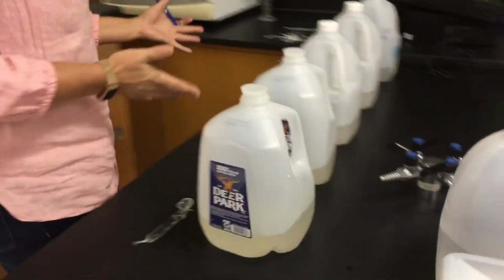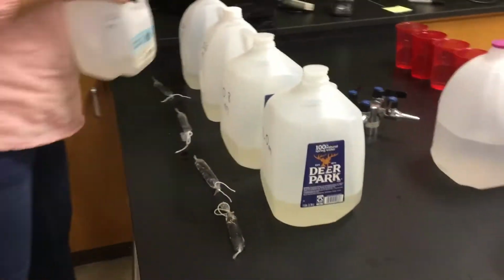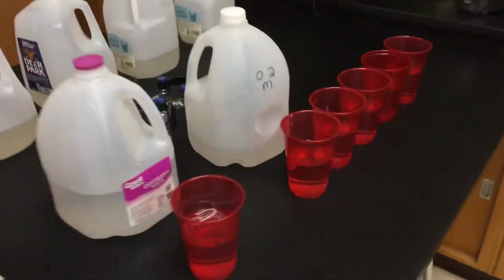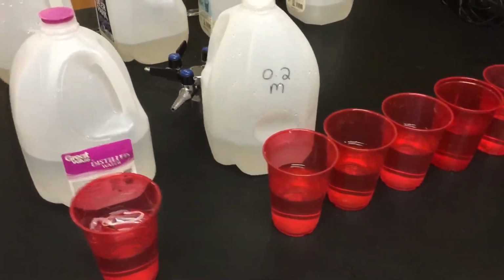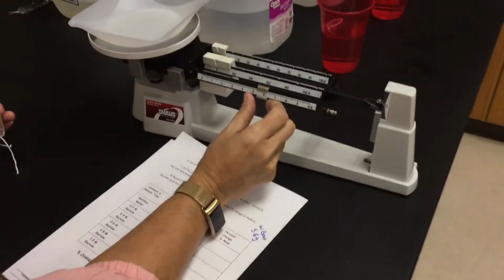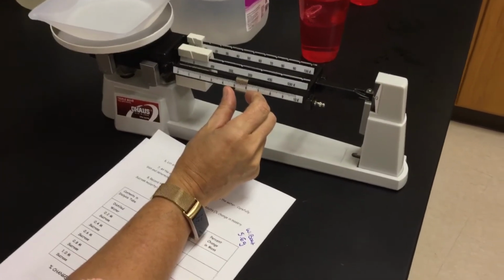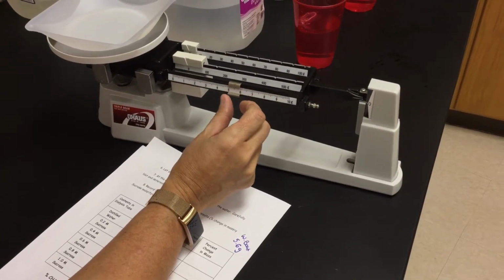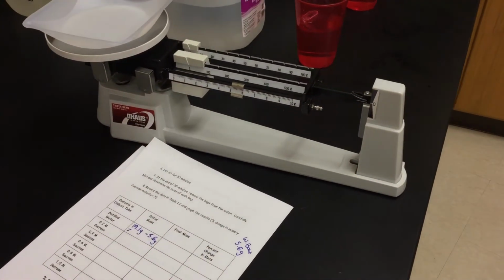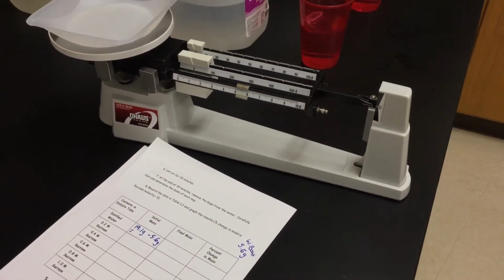So these I've made up earlier for you inside my dialysis tubing. We've stuck 15 mLs of 0.2 within there. I'm going to put that on my next one there. I'm going to reset my scale. I want to make sure that I'm still at about the same location, because as I'm going through and utilizing this weigh boat, maybe a little bit of sugar gets stuck into it. I want to make sure my results don't change. Yep, we're good.